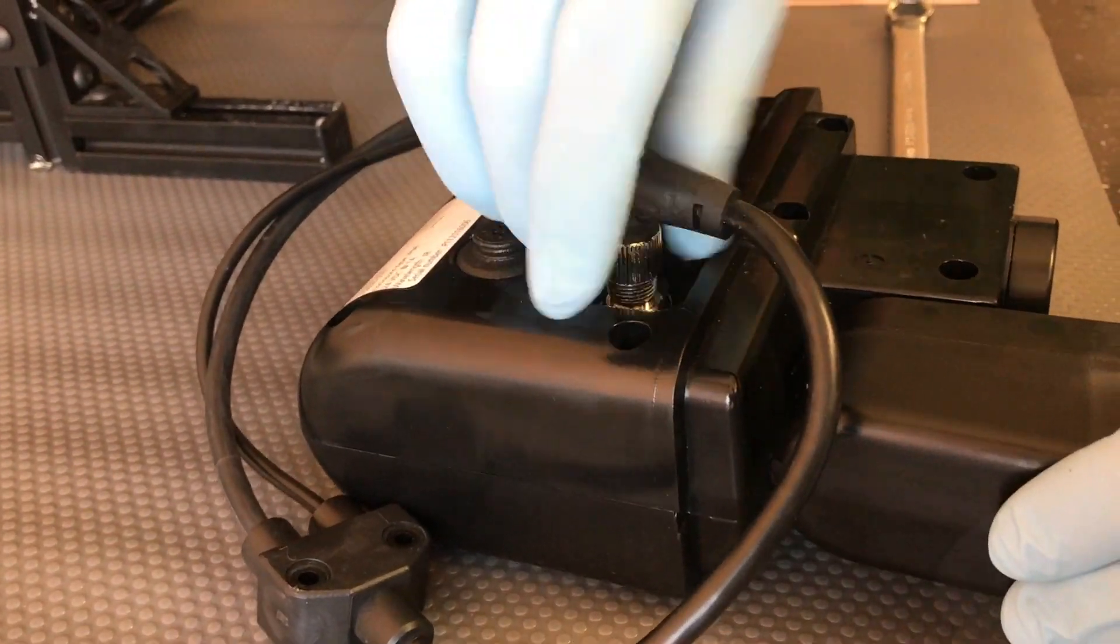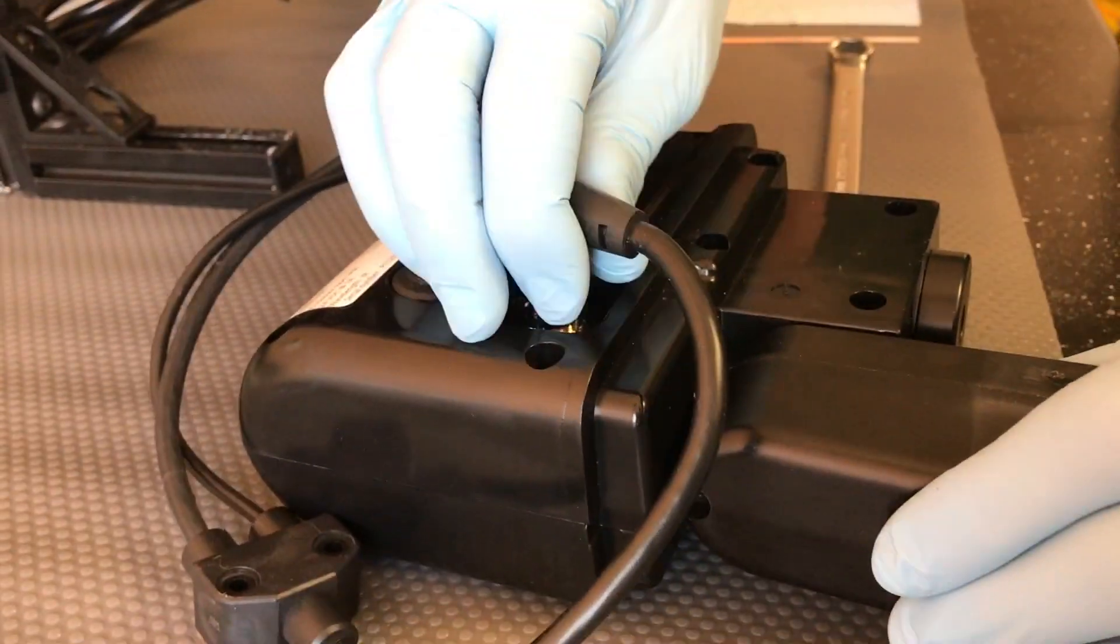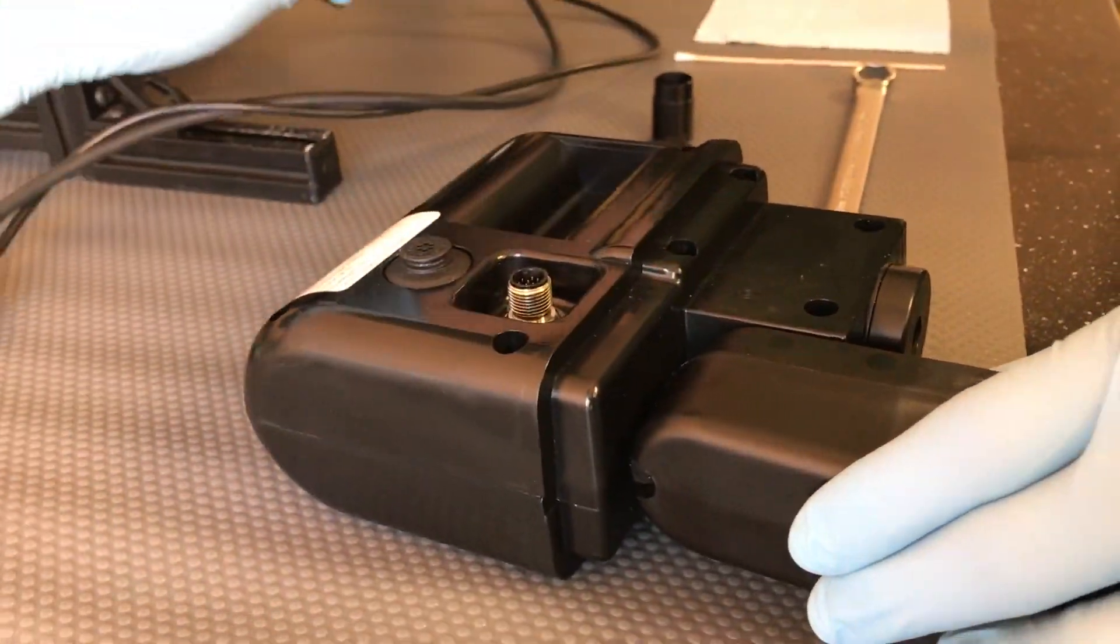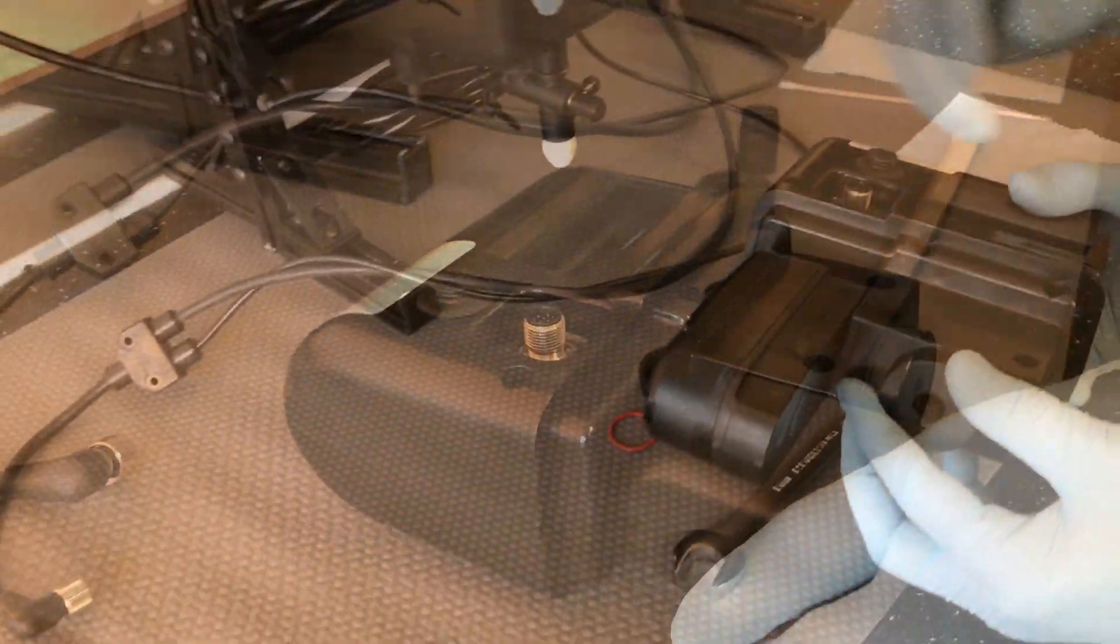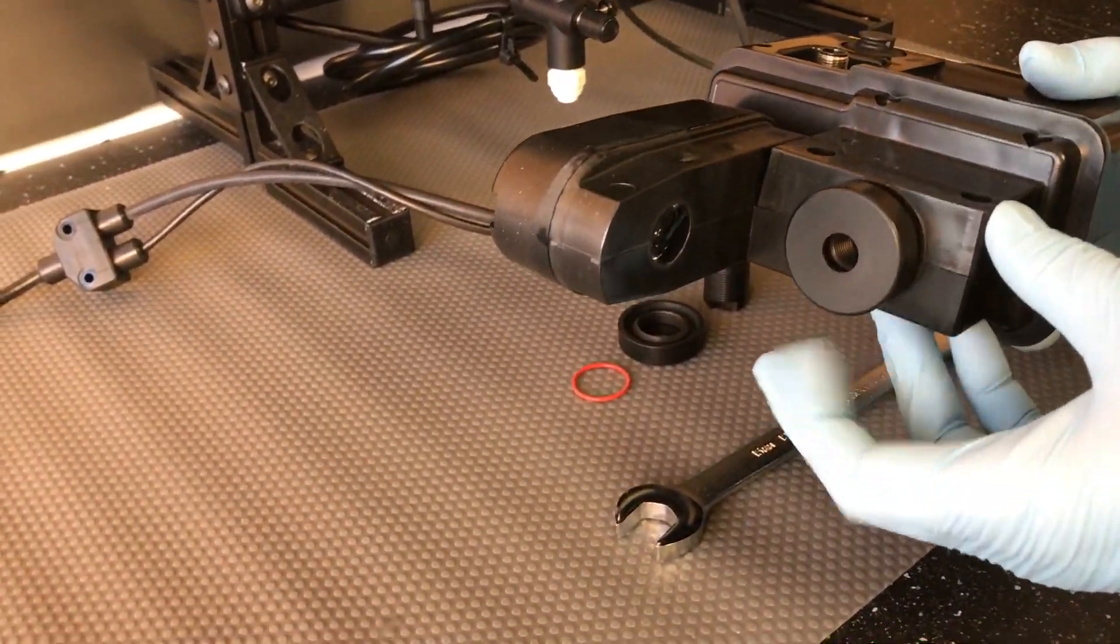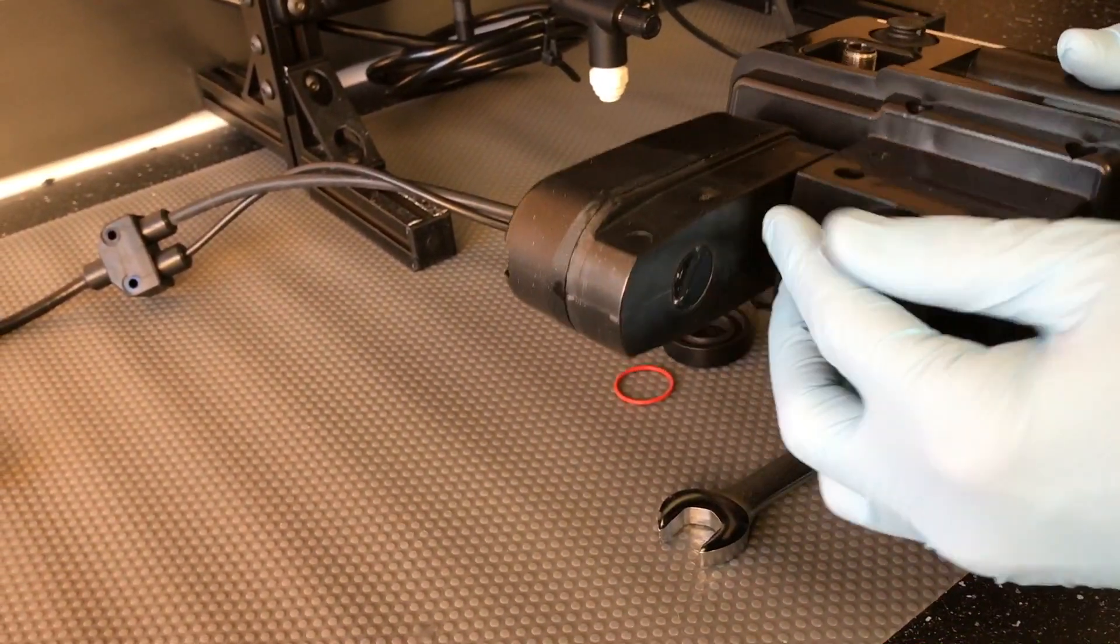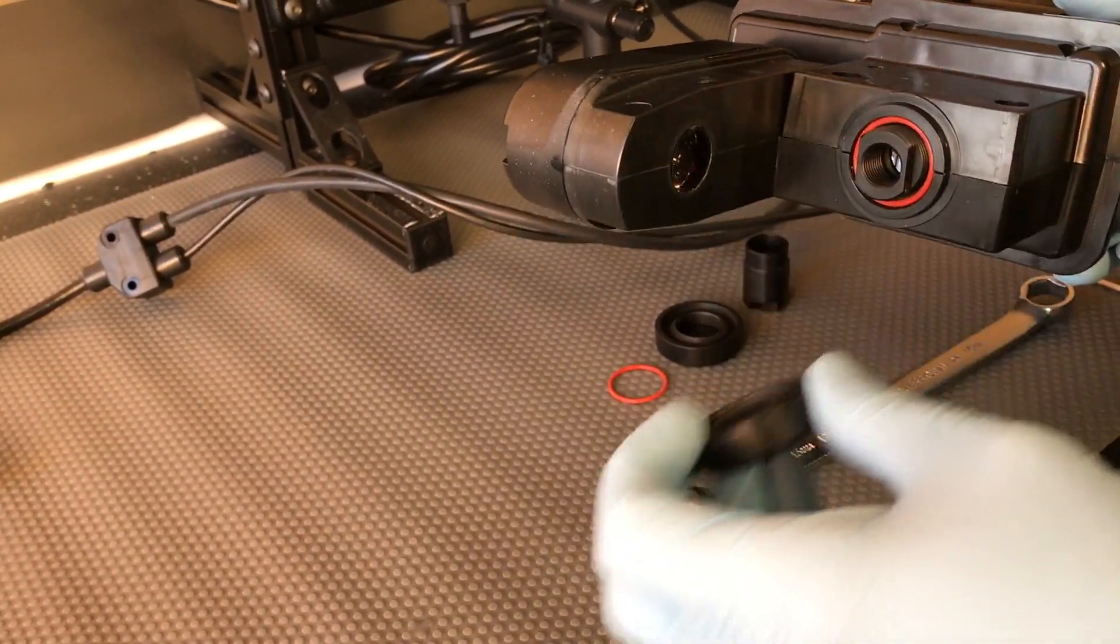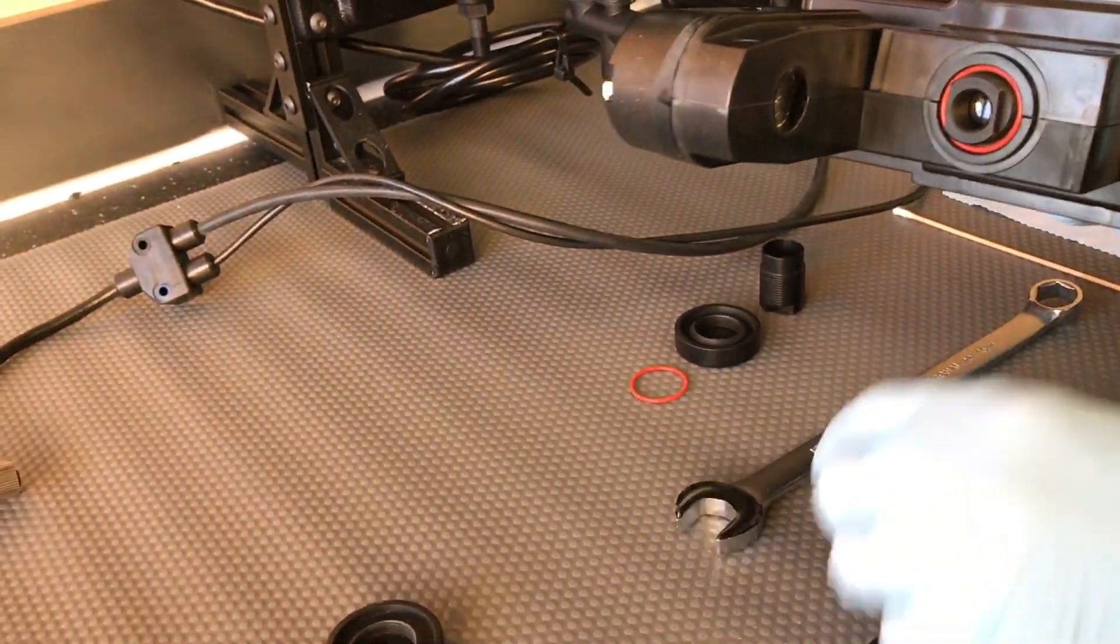Remove the power connection to the back of the module. Unscrew the cap which covers the illuminator assembly in the measurement module and set aside.